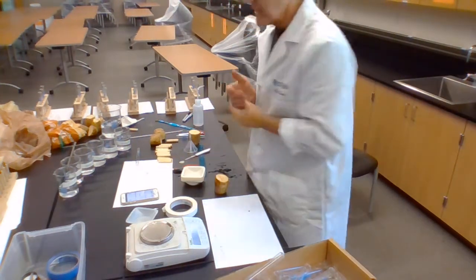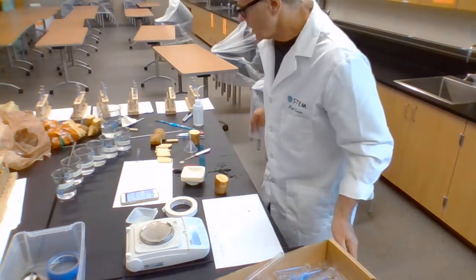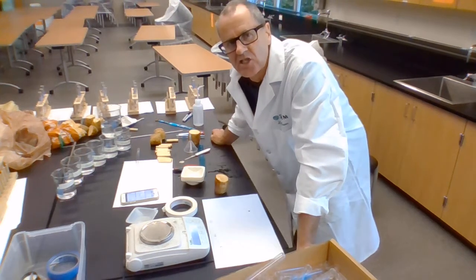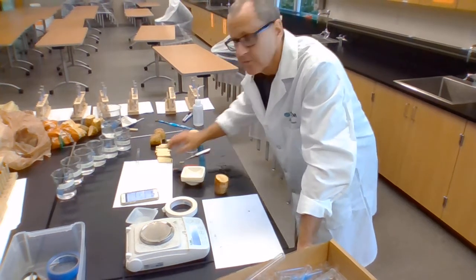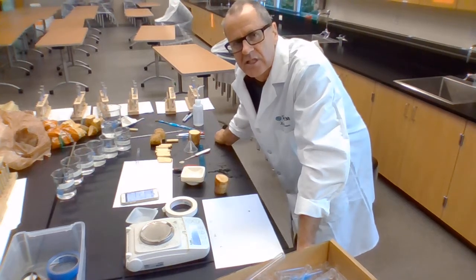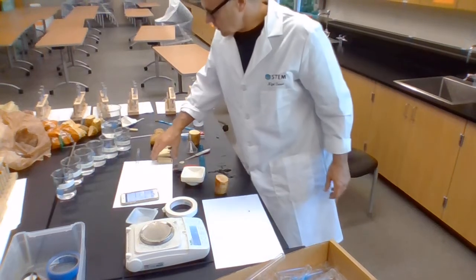So, my independent variable is the molarity of the sucrose solution. My dependent variable is going to be the percentage mass change of the potato cells. And everything else, as far as possible, I should control. I should keep it all fairly constant.